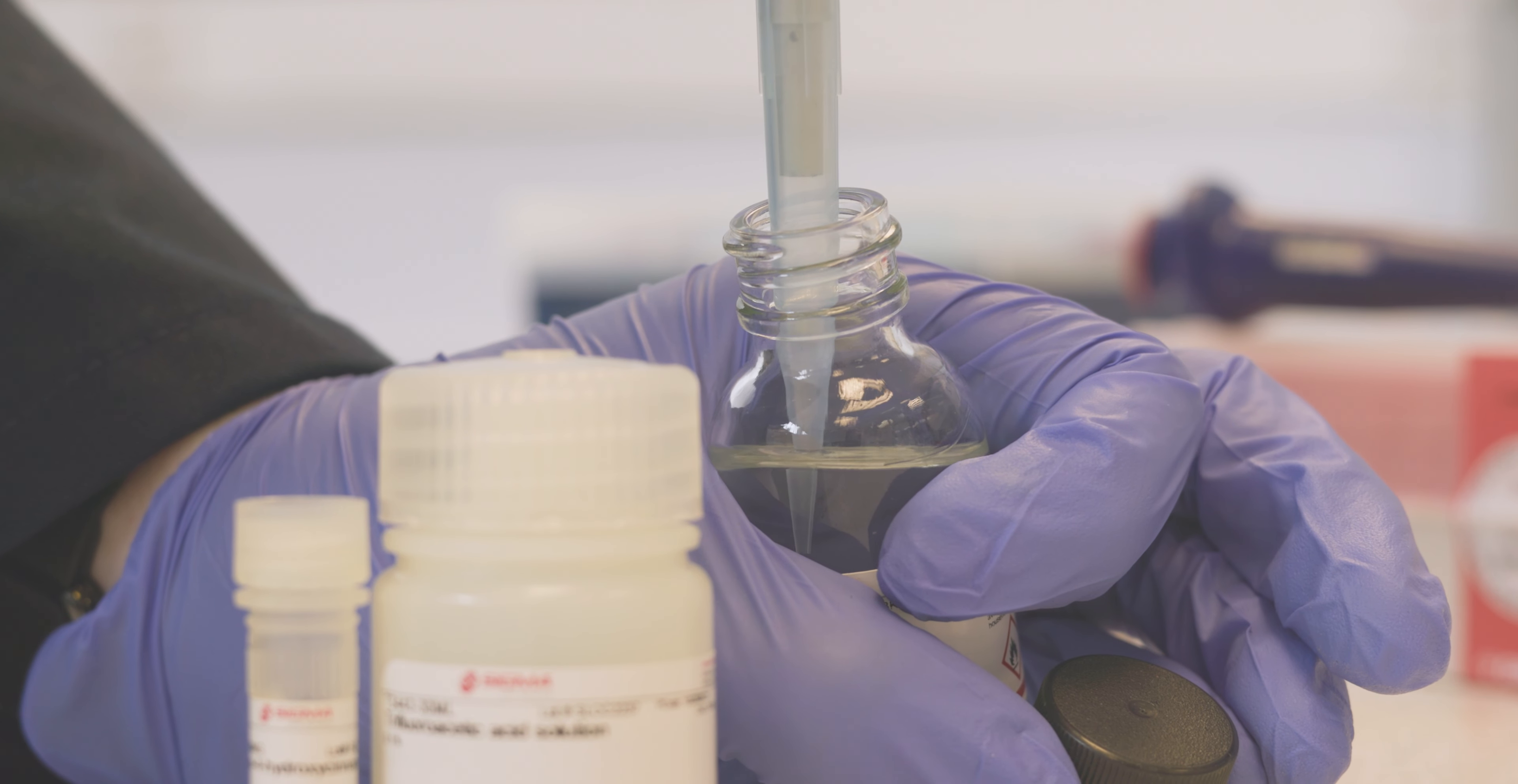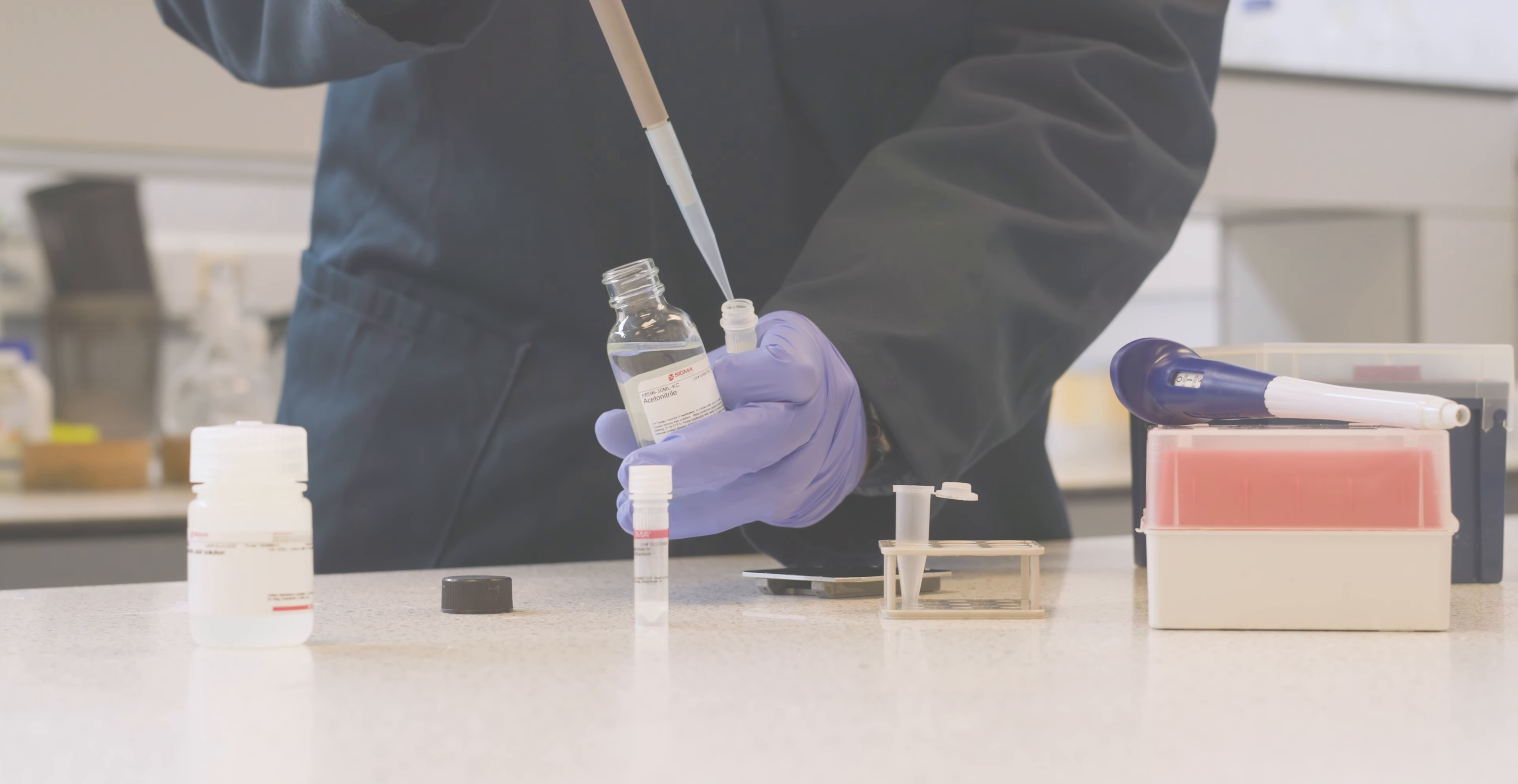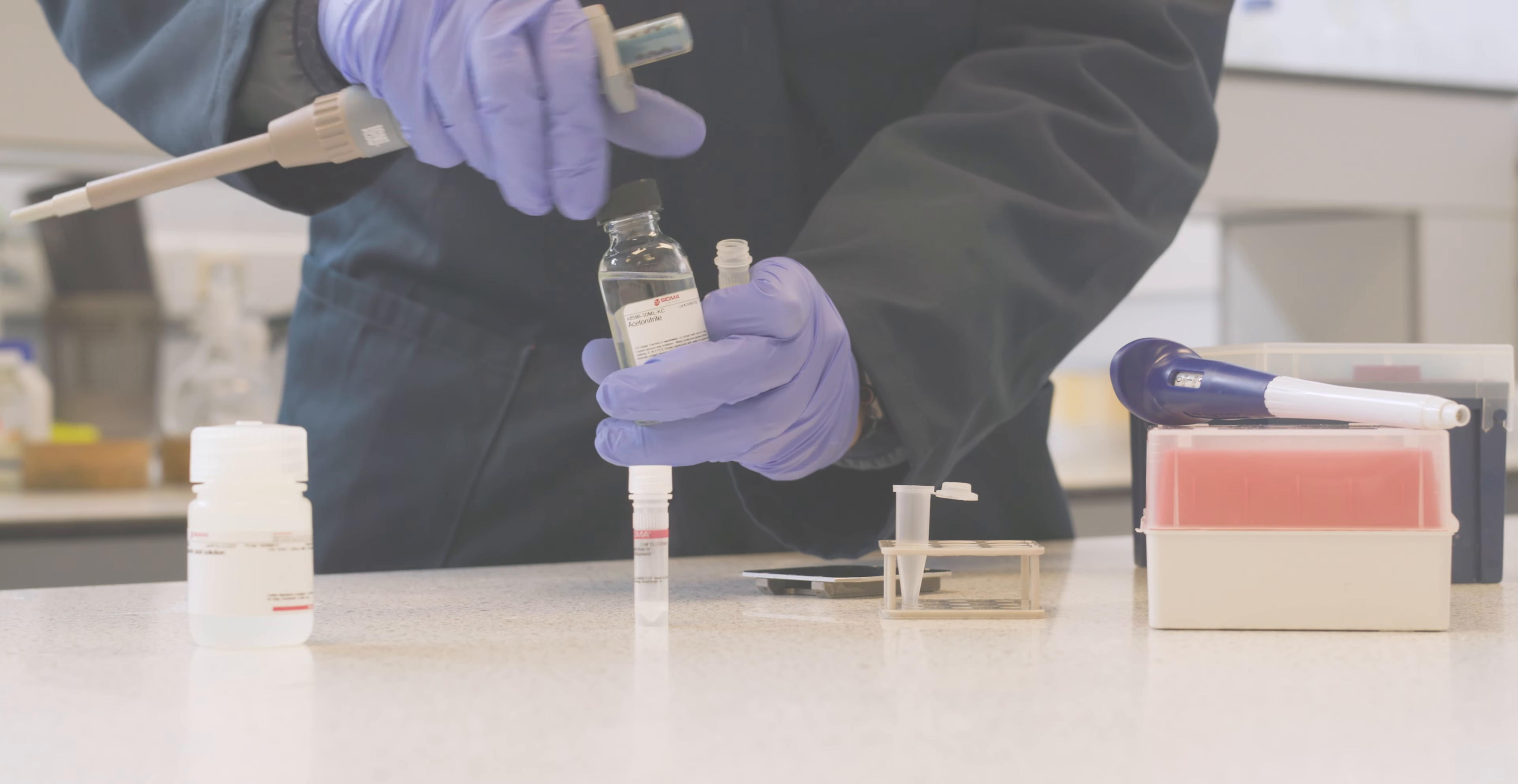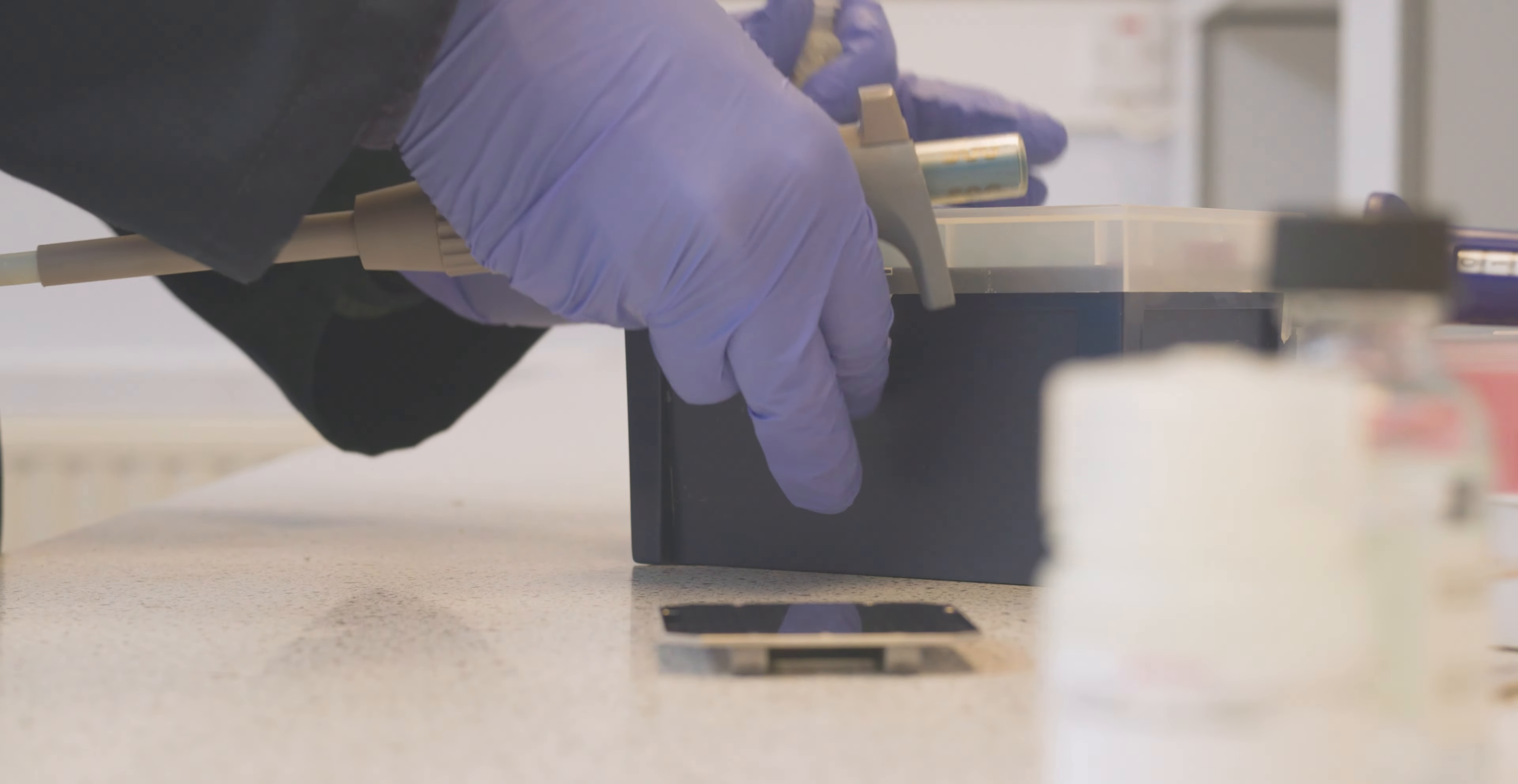First we're adding half a ml of acetonitrile, and then half a ml of 0.1% trifluoroacetic acid. This is to add some acidity to our solution.